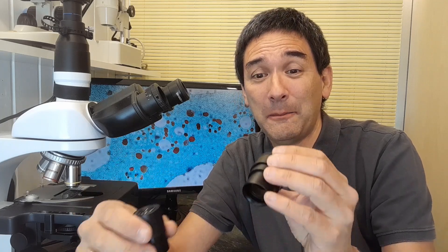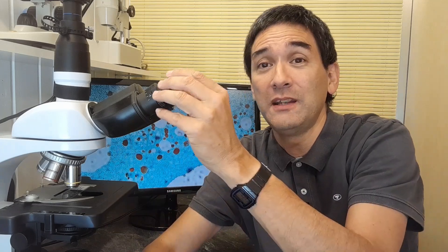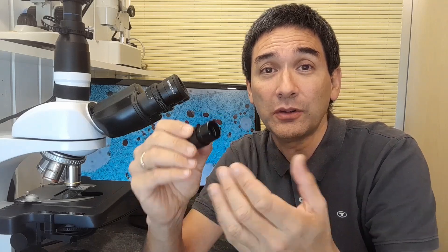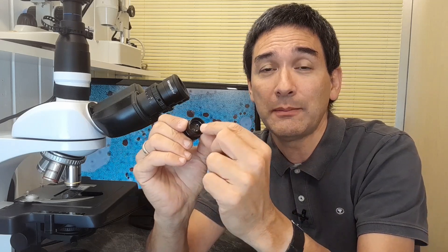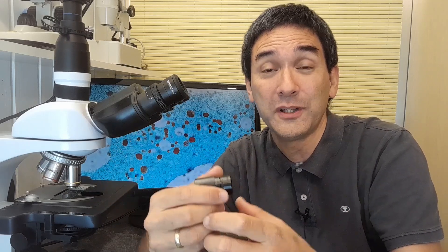The magnification is the same, but eyepieces with a larger diameter have a significantly larger so-called field of view. What does this mean? It basically means that at the same magnification, you're able to see much more of the image. And even though seven millimeters does not really appear to be a huge difference, actually the area that you see is quite a bit larger. However, the barrel diameter alone is not the only thing that is relevant — what is really important is the inside diameter of the lens, which is basically the aperture through which the light is able to pass. The larger the barrel diameter of the eyepiece, the wider the field of view can be.